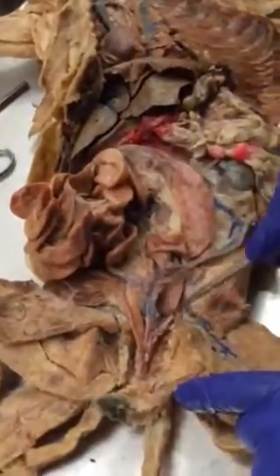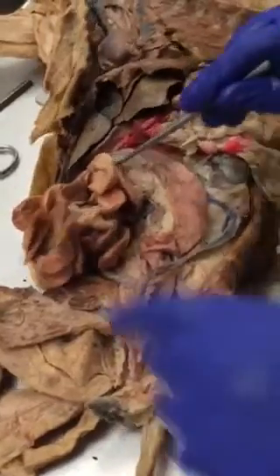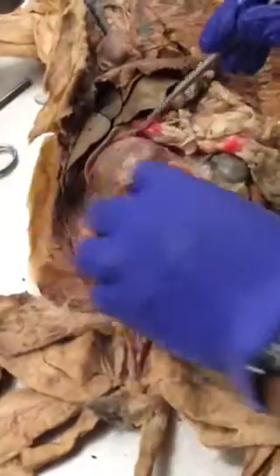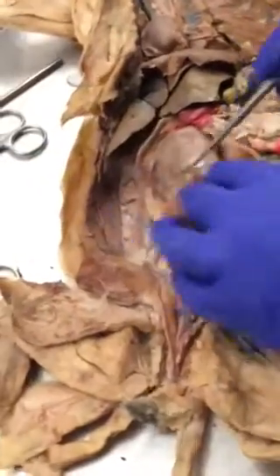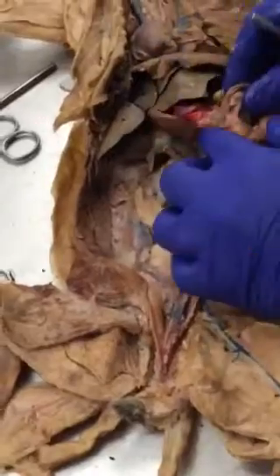So to summarize: rectum, descending colon, transverse colon, ascending colon, and cecum.